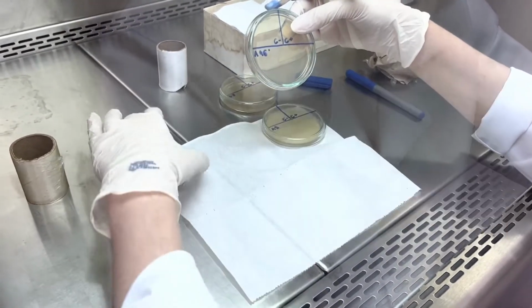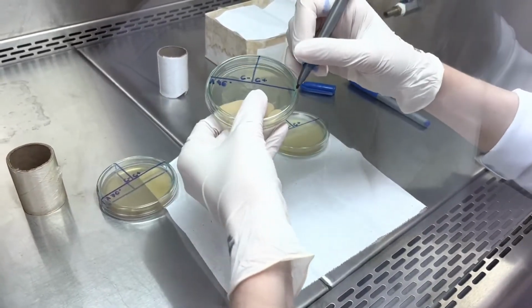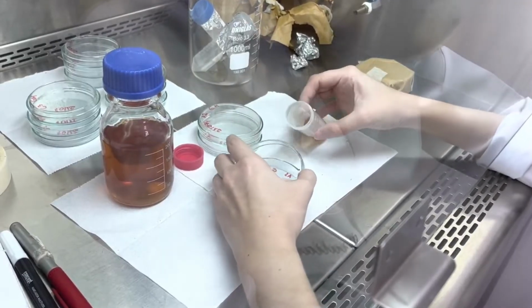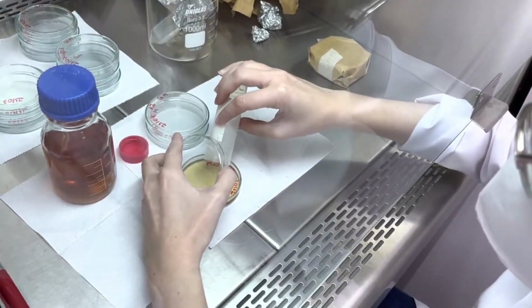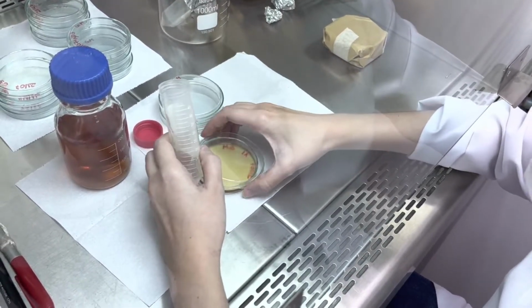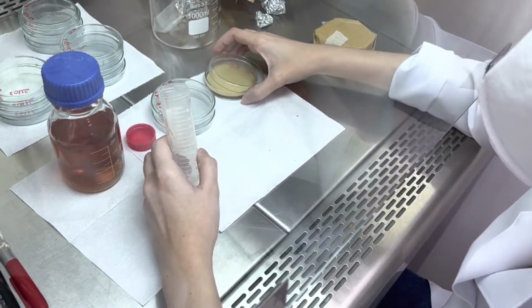The objective of the negative controls was to verify if the petri dishes may have been contaminated during the sample preparation. The positive controls had the objective of verifying if the surface was contaminated with microbiological organisms before the cleaning process. And the product controls, in each dish with a different product, had the objective of verifying the efficiency of the products in cleaning the surface.